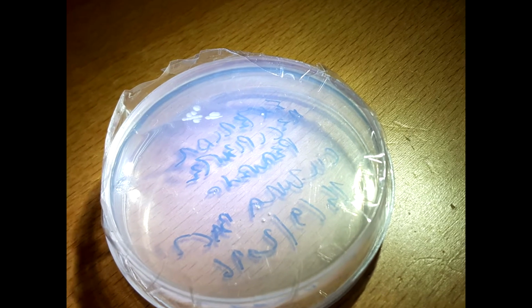This time I decided to run another typically academic experiment of attempting to culture bacteria in a Petri dish filled with nutrient agar. I took these Petri dishes, which I had previously sterilized with ethylic alcohol. I filled these dishes with nutrient agar, and after cooling down and solidifying, I rubbed each one with a cotton swab contaminated with bacteria from exposed surfaces, namely from a computer mouse, from the outside of a jar containing the Paramecia culture that I've used for shooting the previous video, and also a used car part, namely a piece of the air intake system.